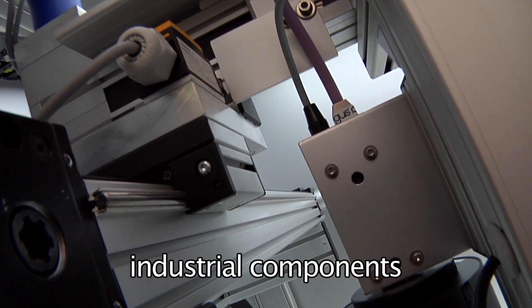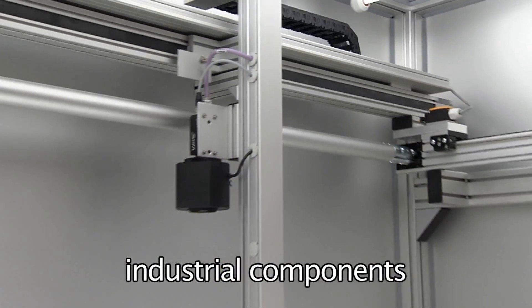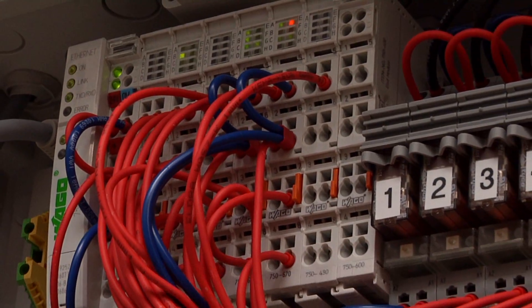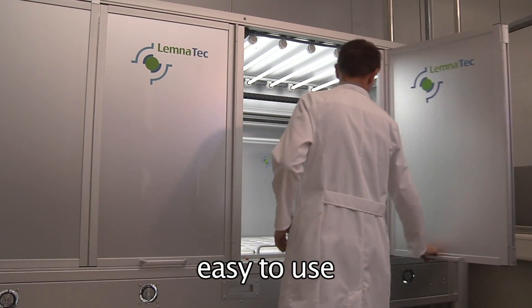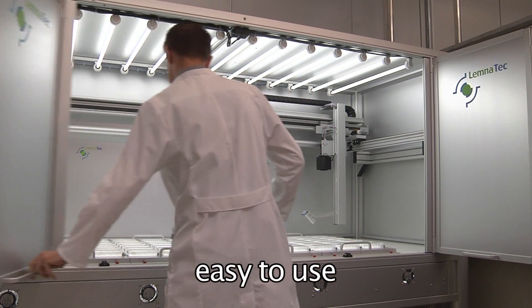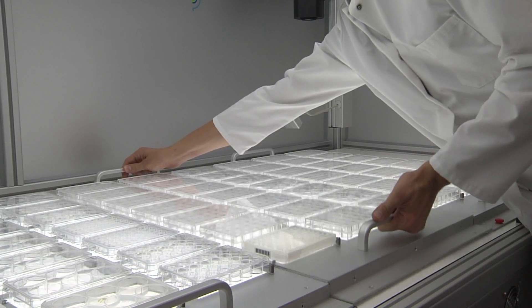Lemnatec exclusively uses standard industrial components that are easy to maintain for all its hardware components with worldwide service support. All vessels and microtiter plates are accurately positioned in customized multi-vessel trays, allowing for easy access to all vessels and also for quick removal.